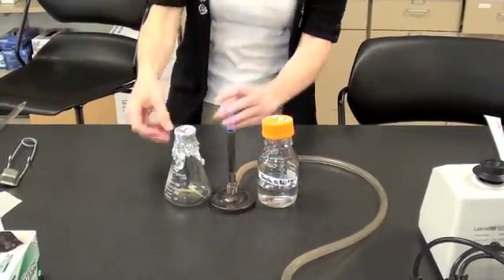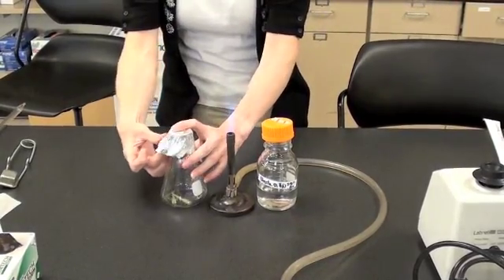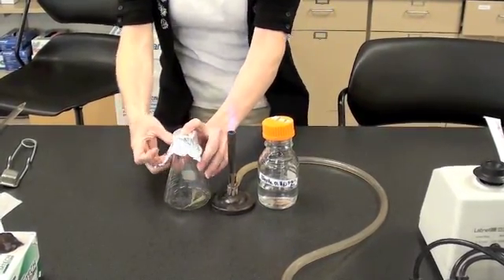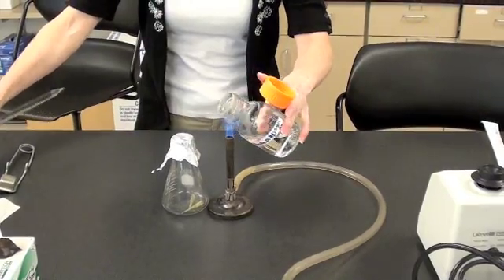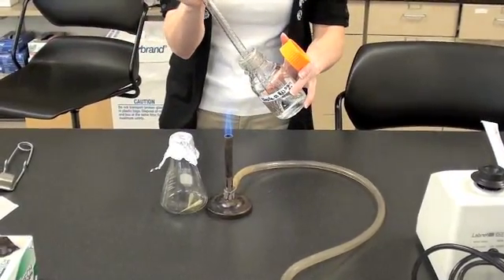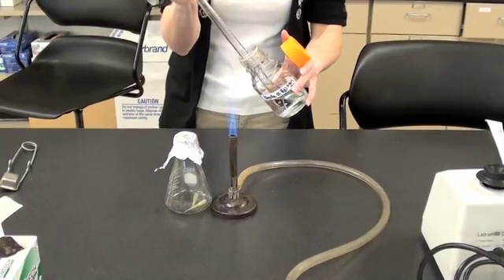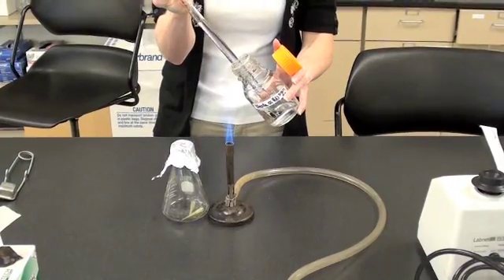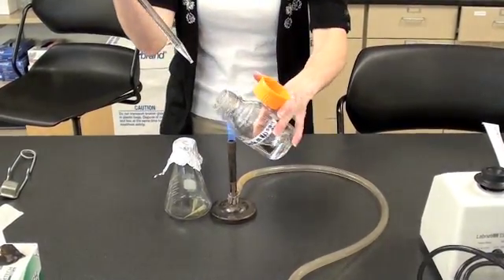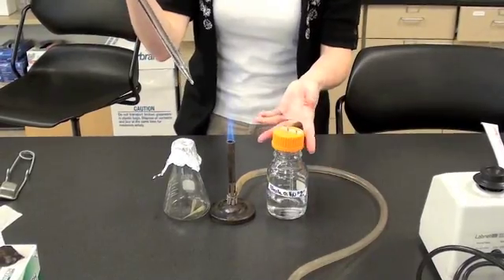Loosen the caps on both vessels. In this case, we're transferring sterile water from a bottle to the flask you'll use for your enrichment culture. Hold the caps in the fingers of one hand. Flame the lips of the vessel. Use a sterile pipette to extract the volume of liquid that you need. Reflame the bottle and replace the cap.